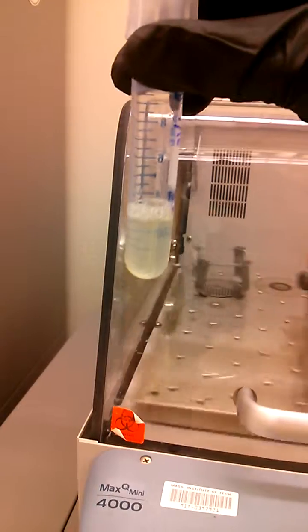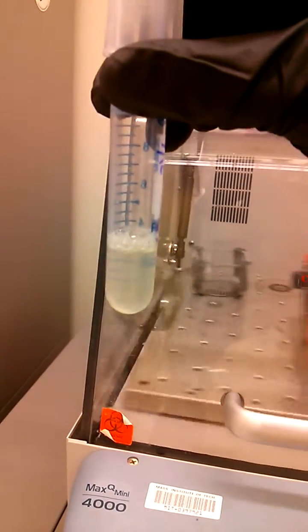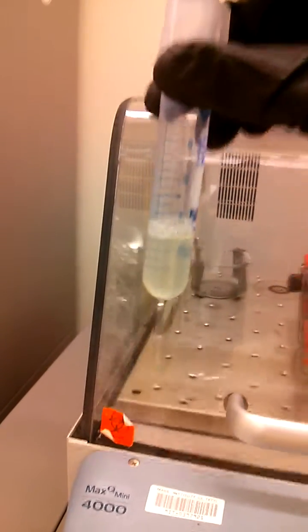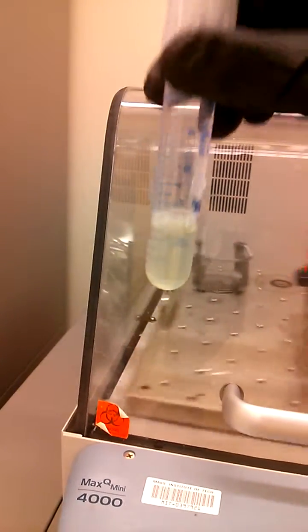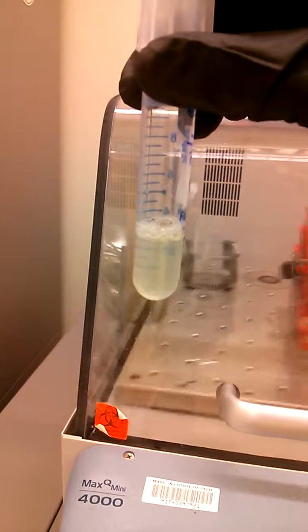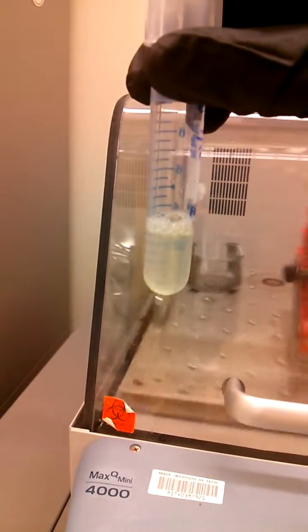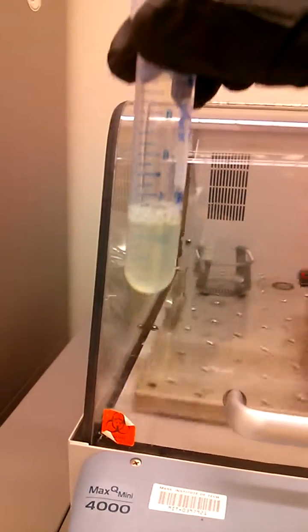We won't go through all those steps because they're relatively straightforward, but basically after a little bit more work, you end up with donor phage stock, which is good if refrigerated for a few weeks. And that's the end of preparing donor phage stock.